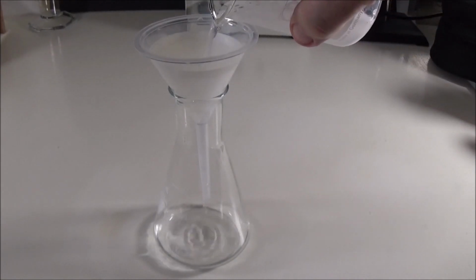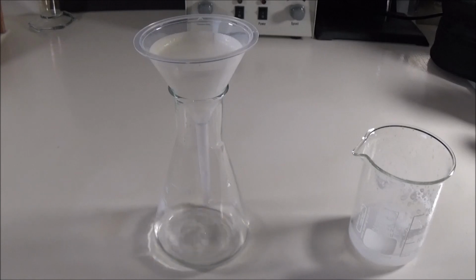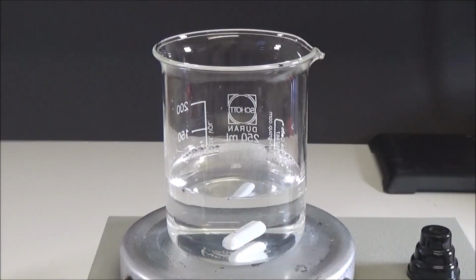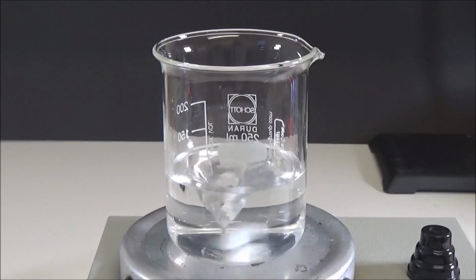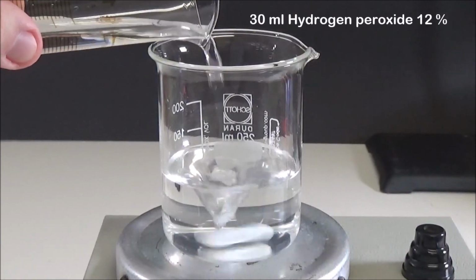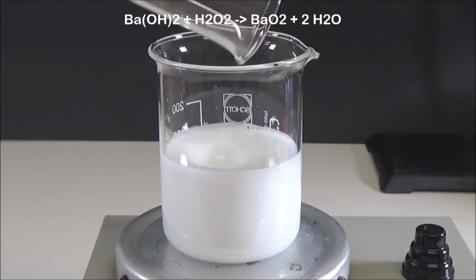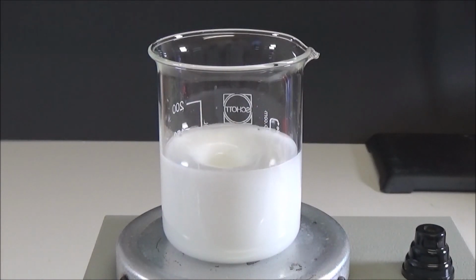Thereafter, the solution obtained in this way is separated from the undissolved matter by simple gravity filtration. In the next step, the filtrate is again poured into a beaker and mixed with 30 ml of 12% hydrogen peroxide solution while stirring. This corresponds to a multiple excess but promotes complete conversion, as does continued stirring for several minutes, although the product largely precipitates directly when mixed. Barium peroxide and water are formed from barium hydroxide and hydrogen peroxide.